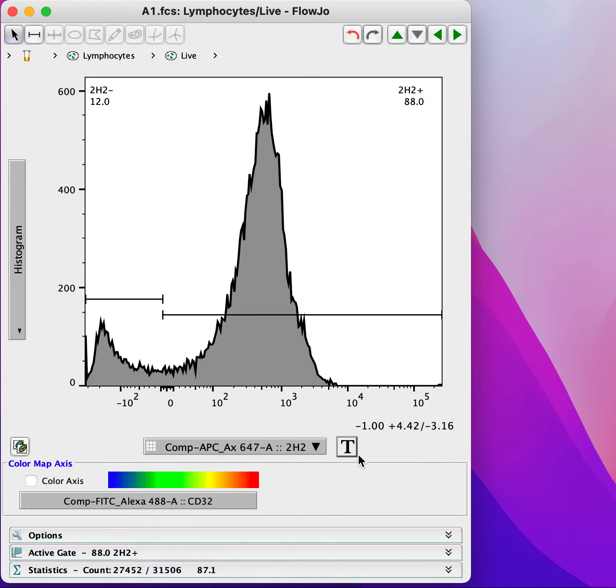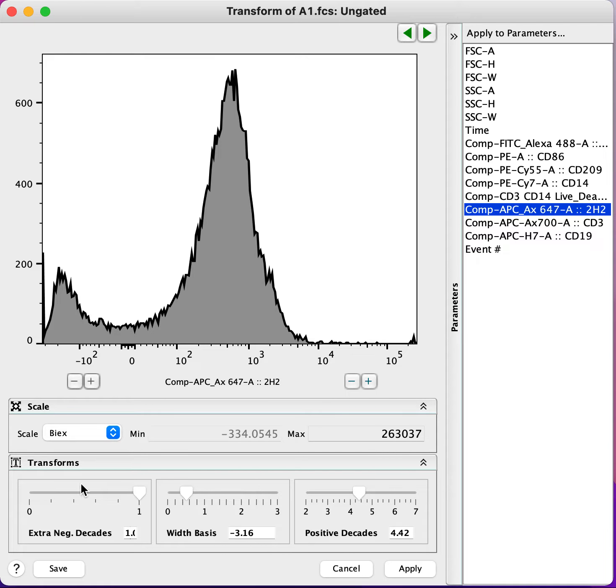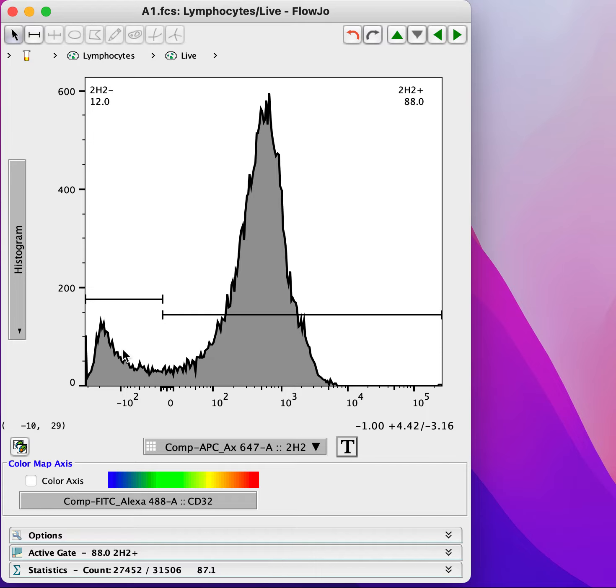Now, I'm not saying here that it's never valid to change these settings, to transform your data differently, but you should be very careful doing so that you're not making a view of the data that is misleading like this. And the thing that really you should be paying attention to mostly is where on the scale you're putting a division between negative and positive, and that if that division is very close to 0, then there's probably something wrong.